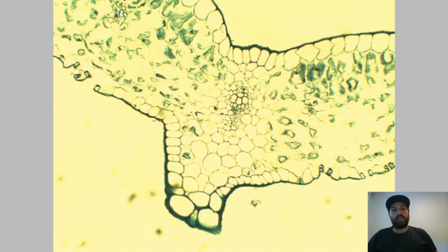And then our next most powerful photosynthetic cells are the mesophyll cells, our spongy cells here. Not very densely packed, right? Again, you can follow on page 140 to look at this. Not very densely packed, but still undergoing photosynthesis, still containing chloroplasts. These are not as densely packed because they're trying to maximize any gas exchange that might be occurring within the leaf by not being so confined in terms of space.